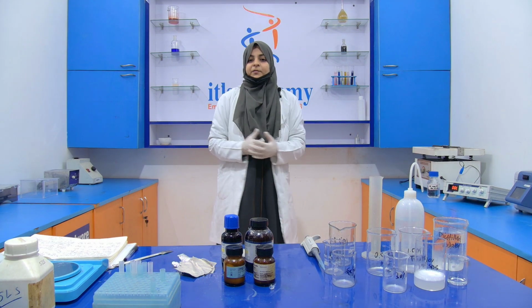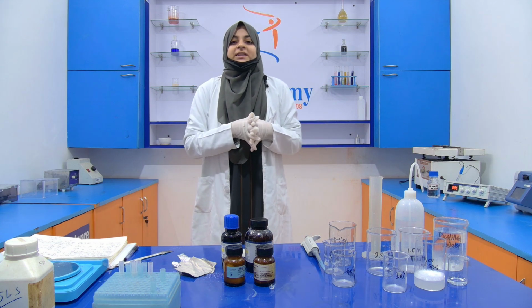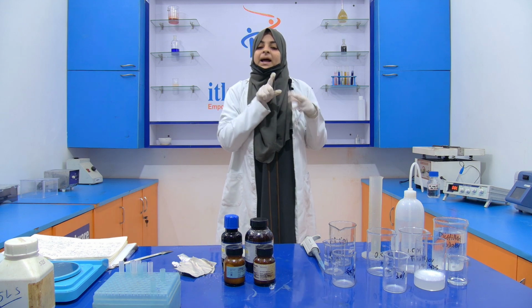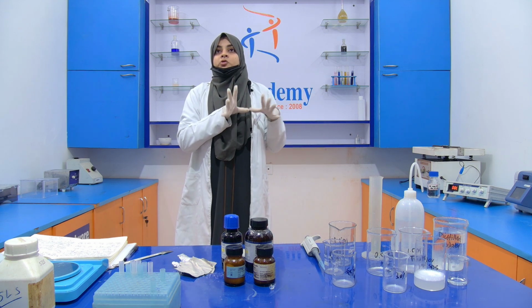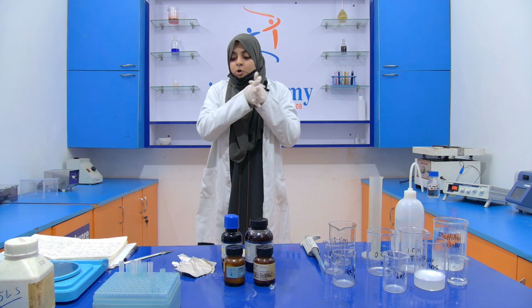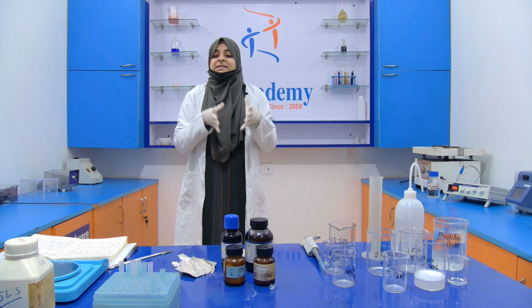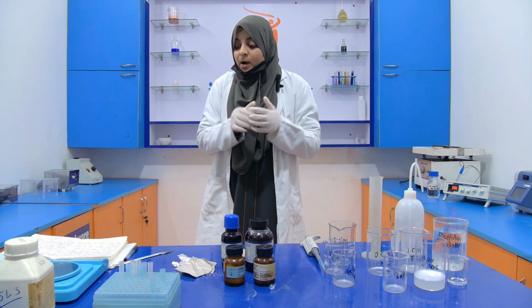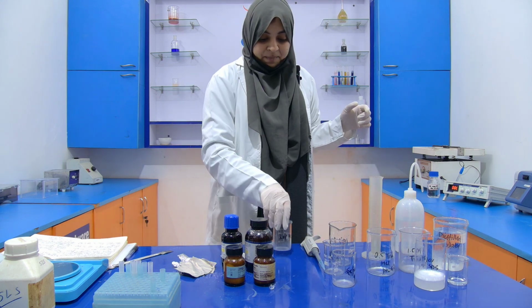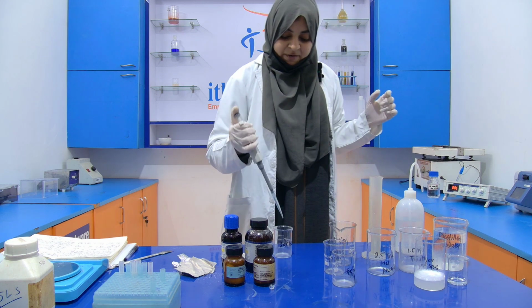Now the next chemical that we are going to prepare is the 30% acrylamide. For the preparation of the 30% acrylamide, we need two chemicals. One is bisacrylamide and another is acrylamide. Okay. So if you are preparing 30% acrylamide for 100 ml, you require 29.2 gram of acrylamide and 0.8 gram of bisacrylamide. Here we are going to prepare it only for 5 ml. Okay. So again, with the help of the micropipette, I am going to take 5 ml.